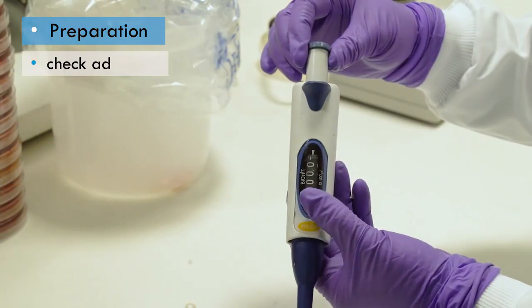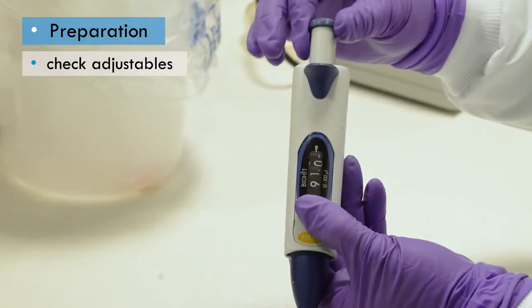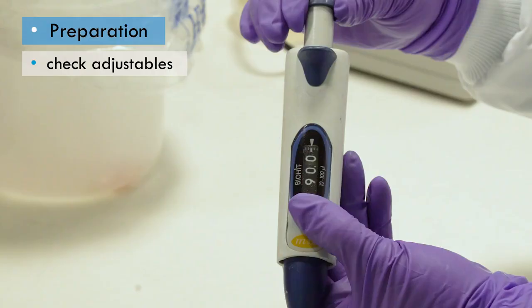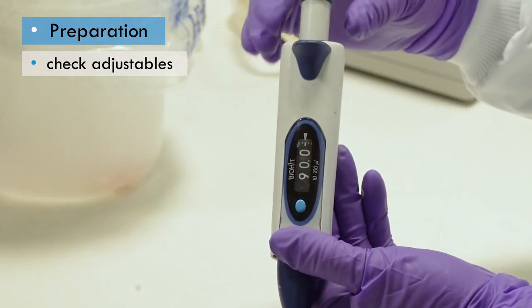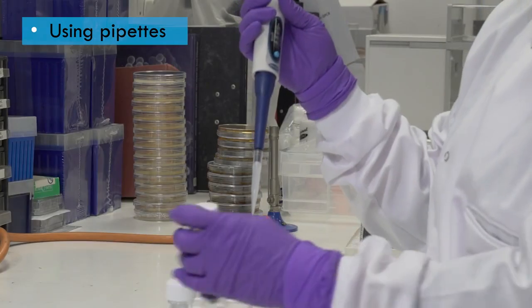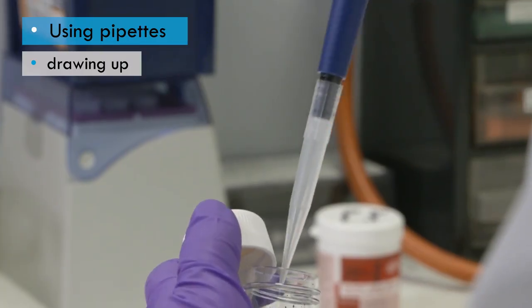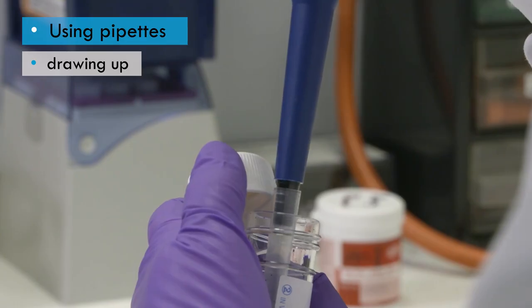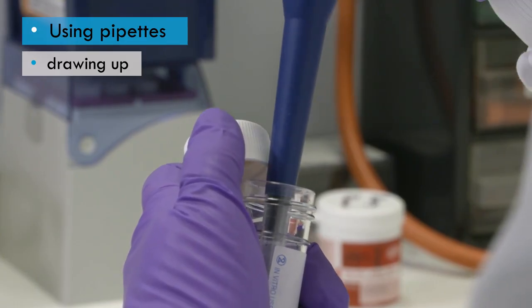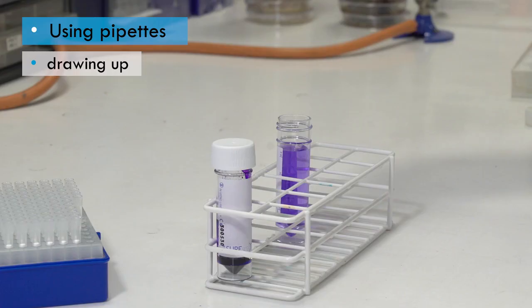For adjustable pipettes, where possible, preset them to the required volume before starting work, as this reduces the likelihood of pipetting the wrong volume of fluid. Make sure the pipette and container of the liquid to be pipetted are held such that your hands do not come into contact with the liquid. If it's not necessary to hold the container, then you should use a rack.